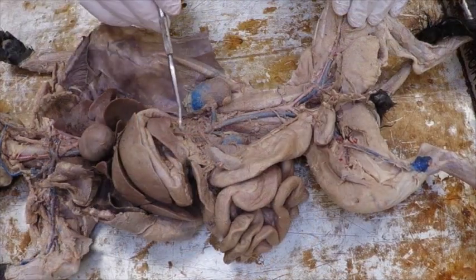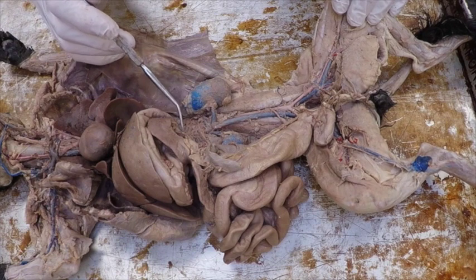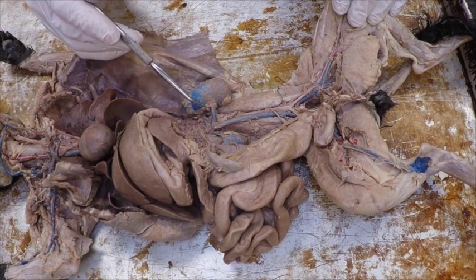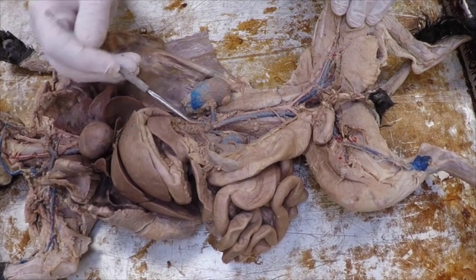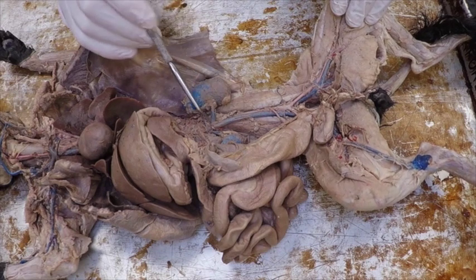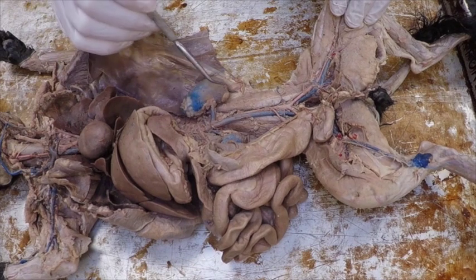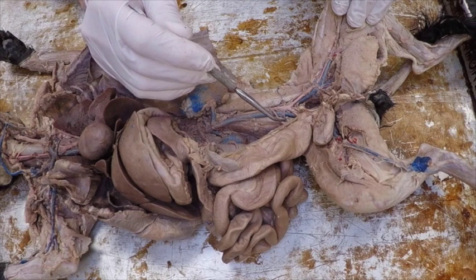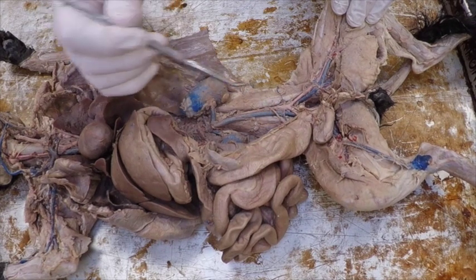Now we're going into the abdominal cavity, which is below the diaphragm. Now I'm going to try to show as many veins and arteries as I can, but not all of them inject and not all of them are easy to find, so there will be some on the list that I don't actually get to. We're going to start here with the inferior vena cava continuing into the abdomen, and we have a renal vein going to the kidney. That's an easy one to see. If I keep going down, we're going to hit what's called the iliolumbar vein right here. There's actually an iliolumbar artery next to it.